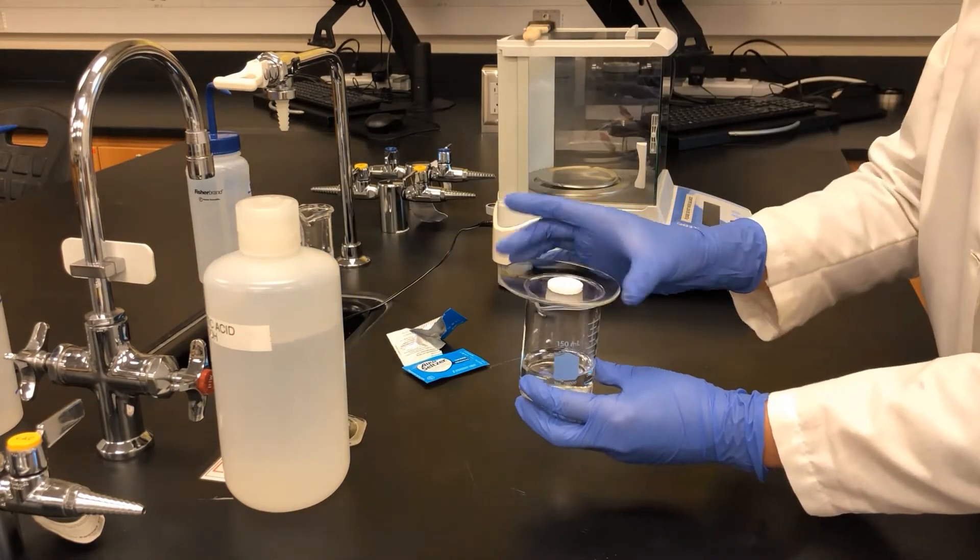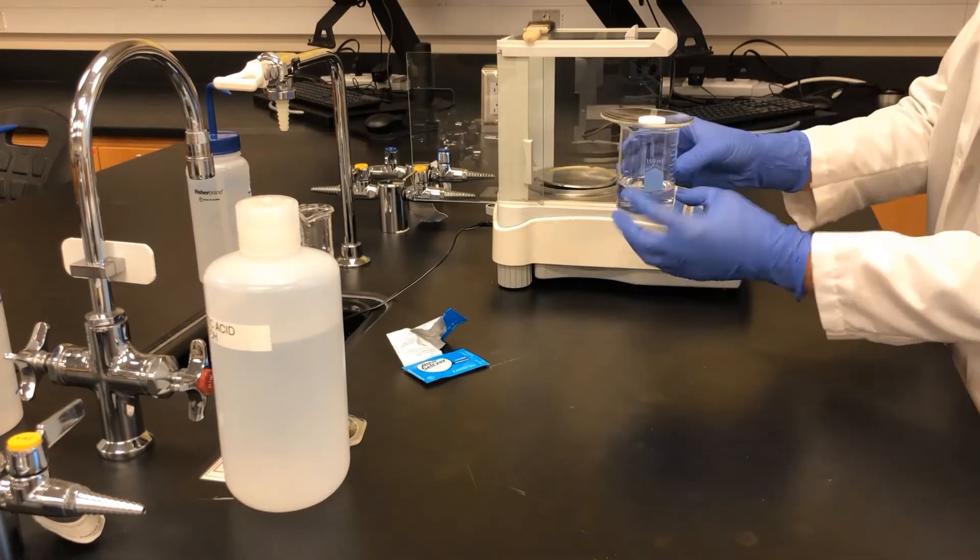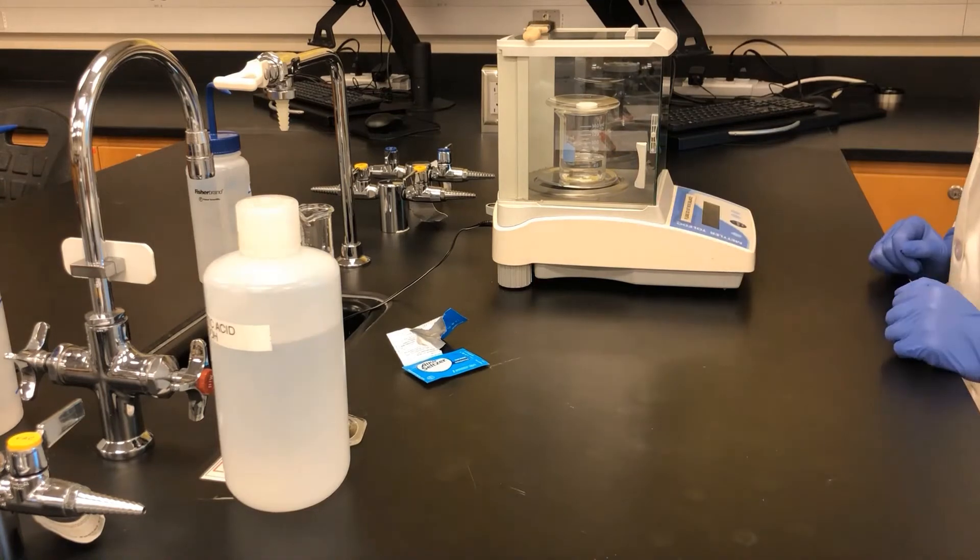The watch glass is placed on top and after zeroing the balance, the entire apparatus is weighed and the mass measured and recorded.